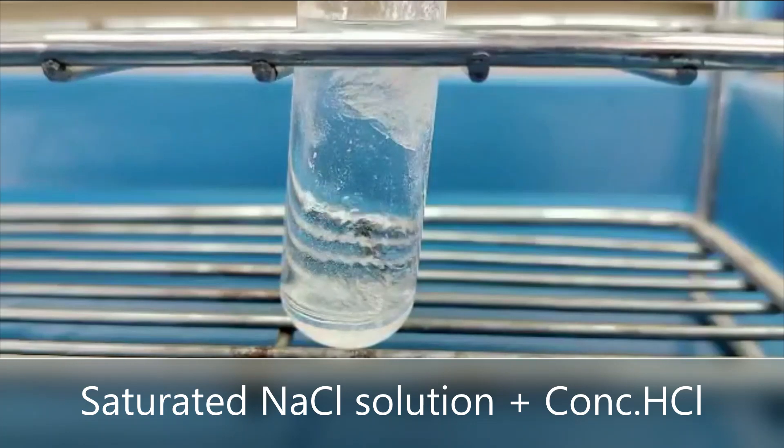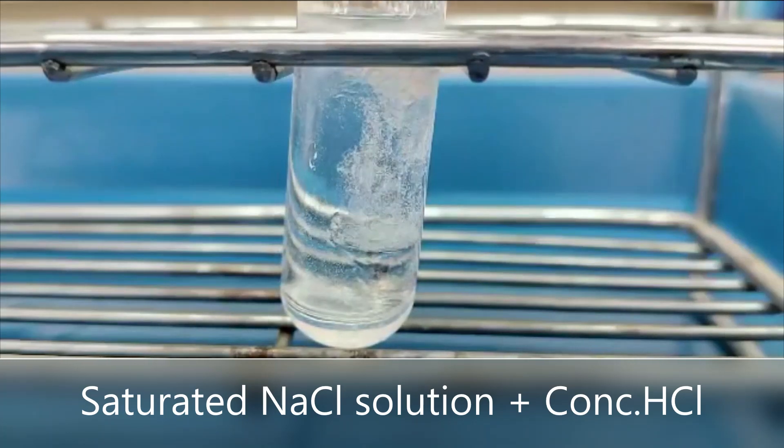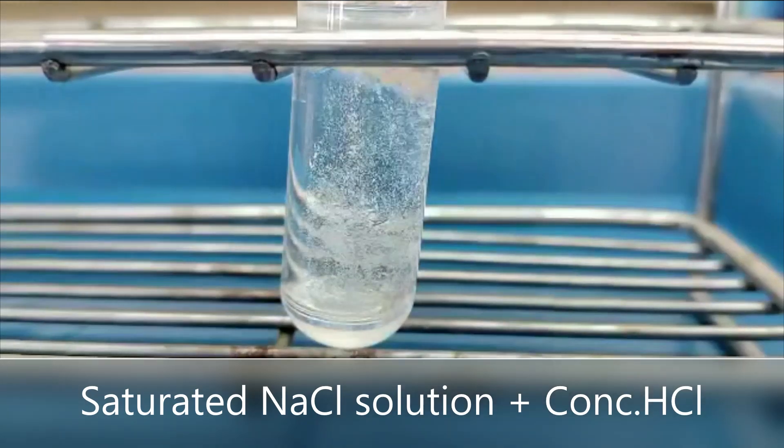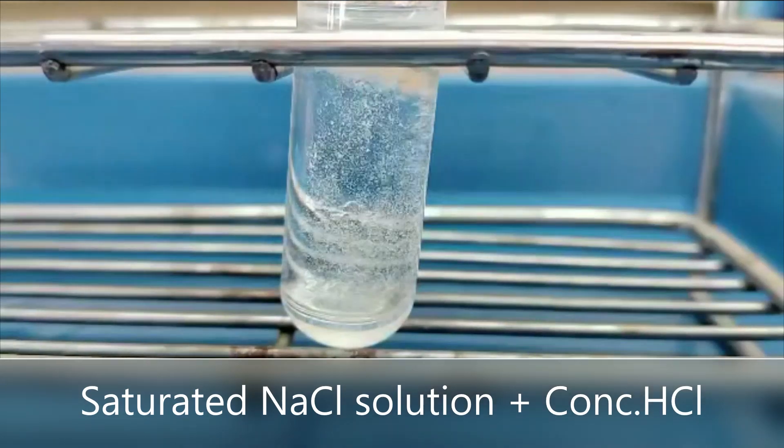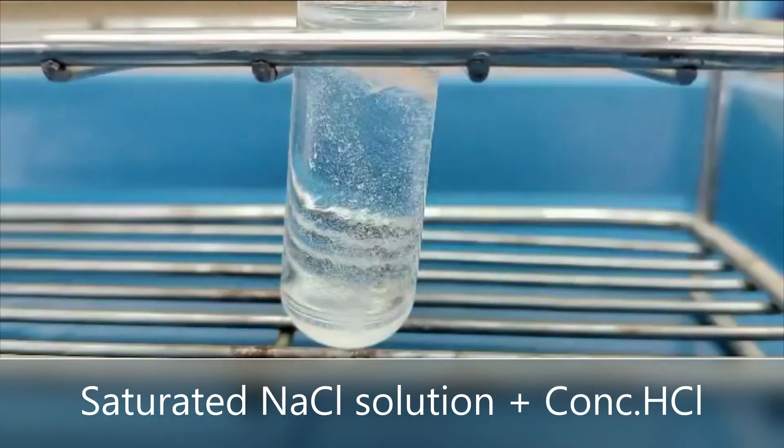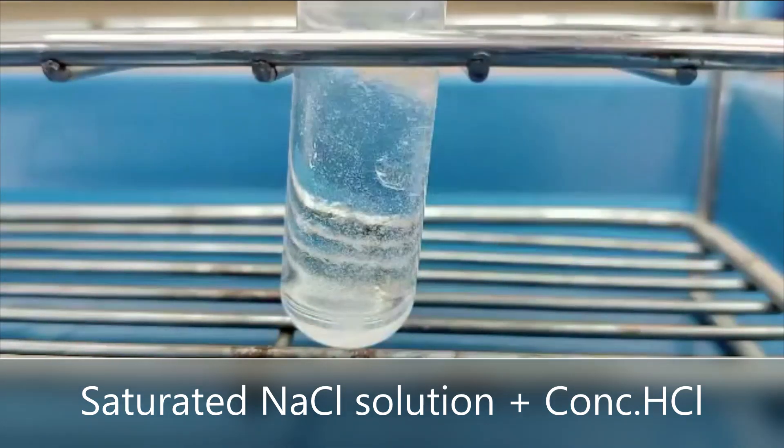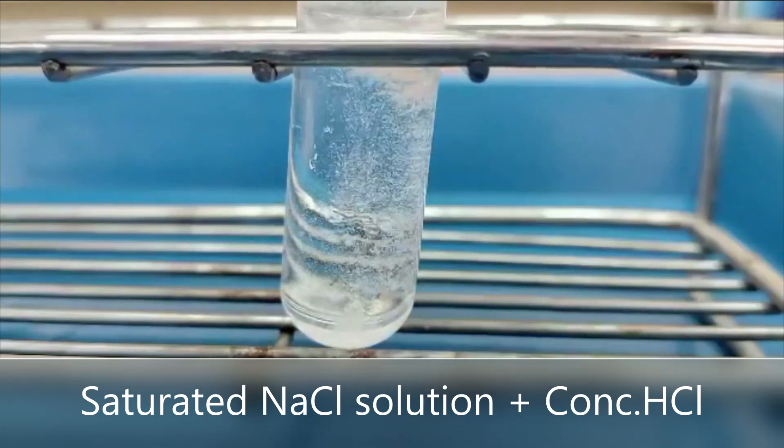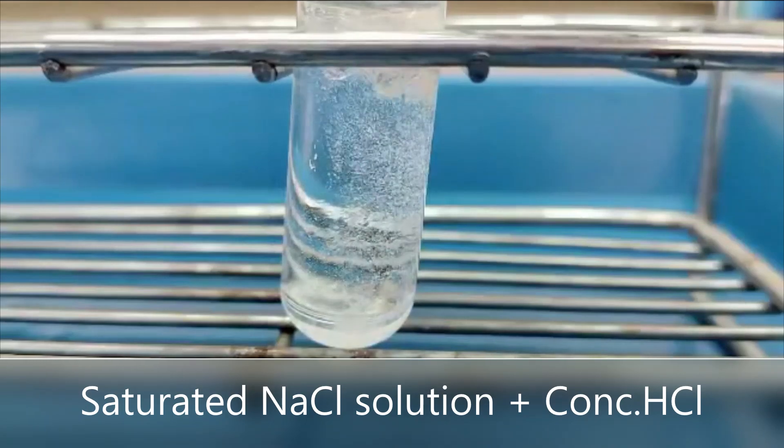Then put the test tube filled with sodium chloride solution into a hot water bath for about three minutes to increase the dissolved salt into a supersaturated solution. Finally, concentrated hydrochloric acid was added to the supersaturated sodium chloride solution.